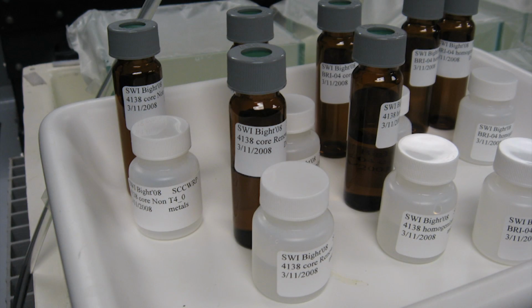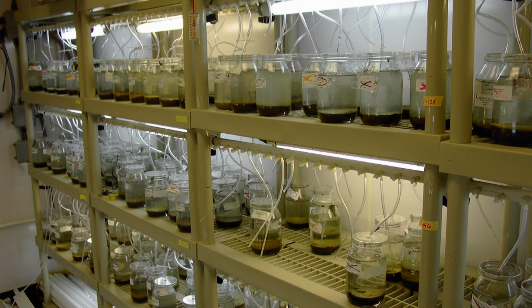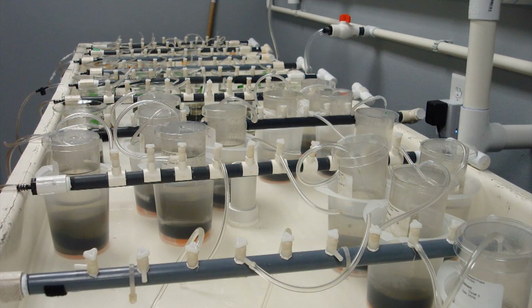When we measure sediment chemistry, we're looking at three main types of constituents. Things like grain size and organic carbon, or trace metal concentrations, or the concentrations of trace organics. The toxicity analyses usually use more than one species. We look at endpoints such as survival, growth, or reproduction following an exposure of 2 to 28 days in the laboratory. So these measurements are pretty easy to make. There are routine methods available. The hard part is figuring out what they mean.